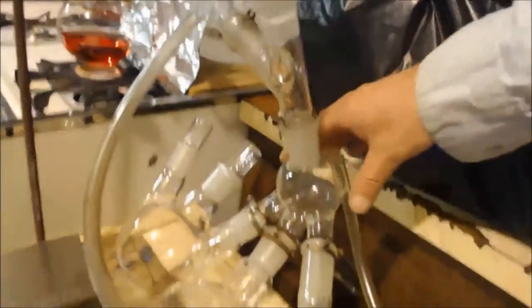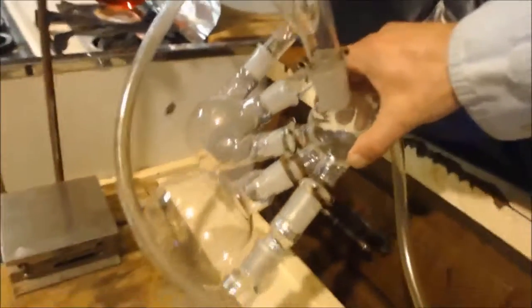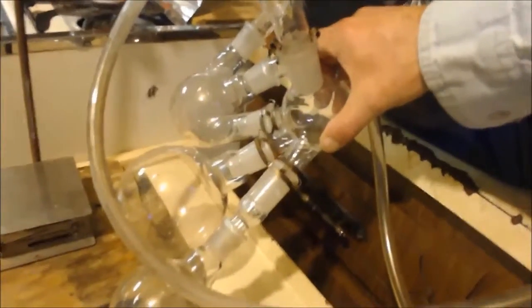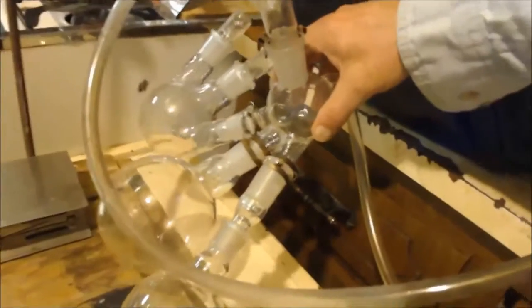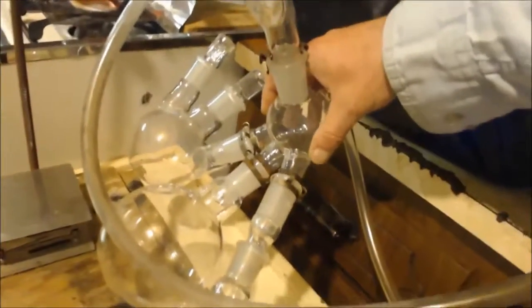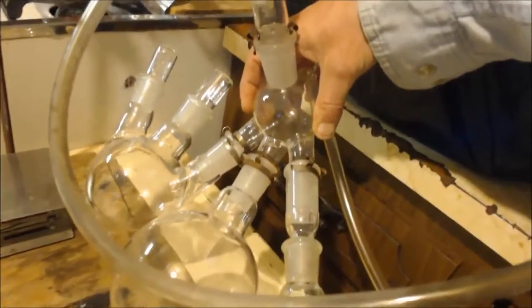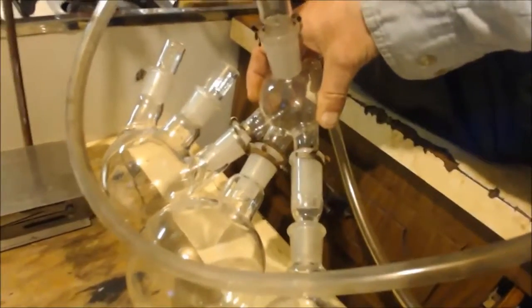I need two hands to do it. But I can move this so that it comes down into that. Then I can move the next one. So now it goes into the middle one. If I go like this, now it'll go into that last one. So I don't have to turn my vacuum off and switch flask and blah, blah, blah. Let my temp go down.